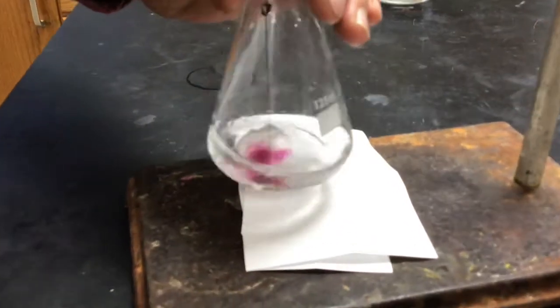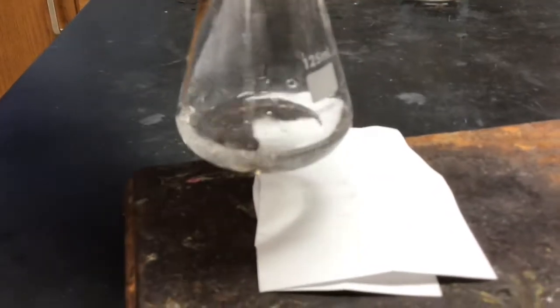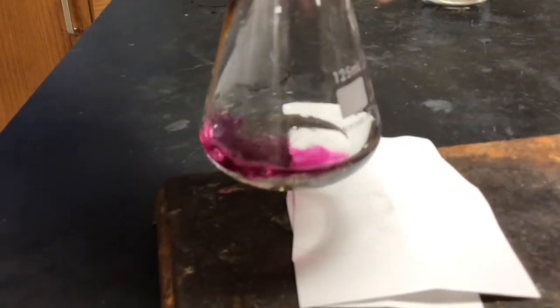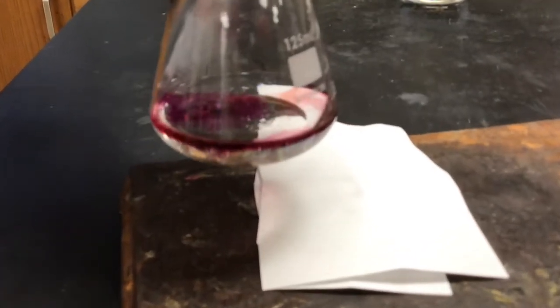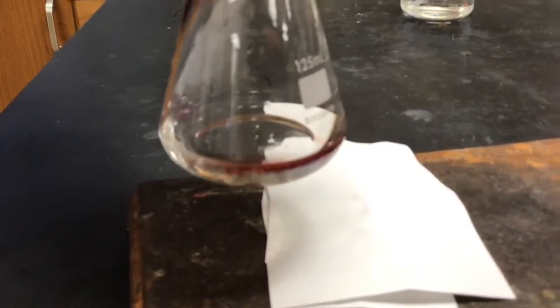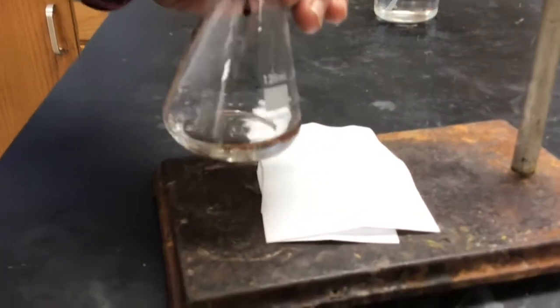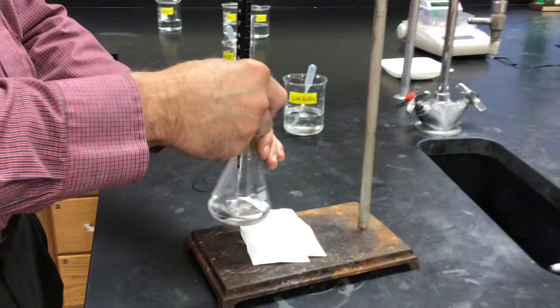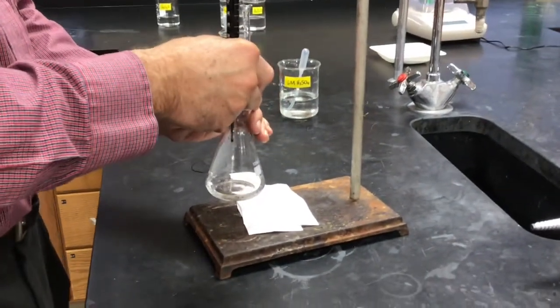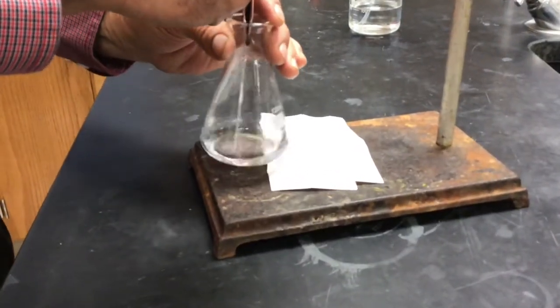Now you'll notice there's something else going on. Add some where you don't shake it so we can see it. See what's happening there? Other than the color change. See the bubbling going on? Is that bubbling happening just because we're shaking two liquids together? Let's look back at the chemical equation. It's always a good idea when you have your chemical equation and you see the reaction, make sure that what you're observing is consistent with what the equation says.